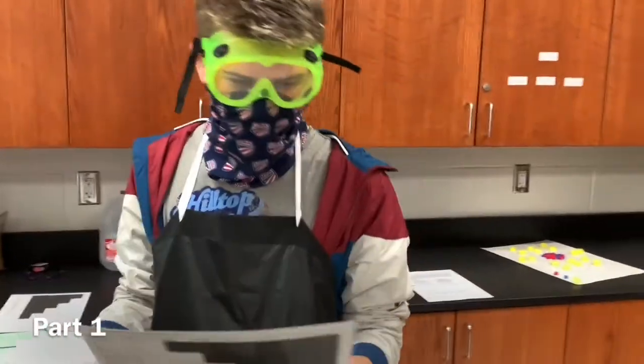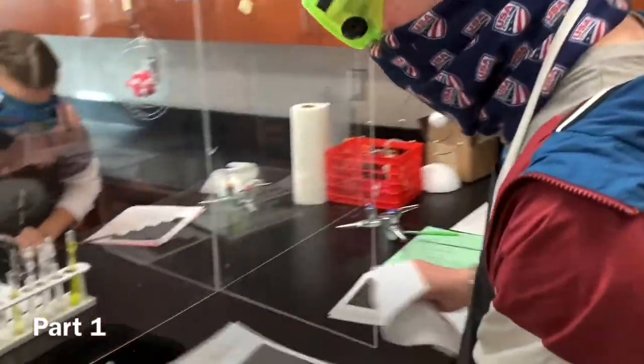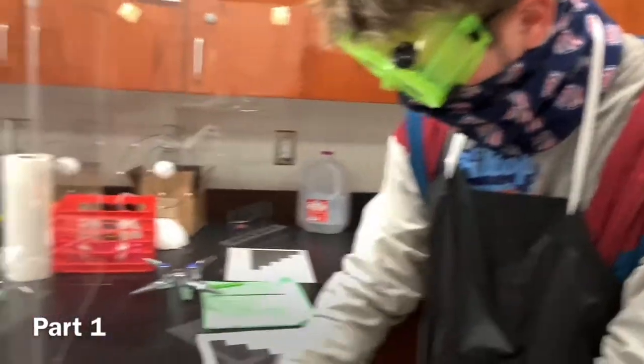Say something. All right, guys. So we're part 1 of the vlog squad. Part 1. Doing part 1 with all this stuff. Just cleaning off the thing to make sure it's good and quality.